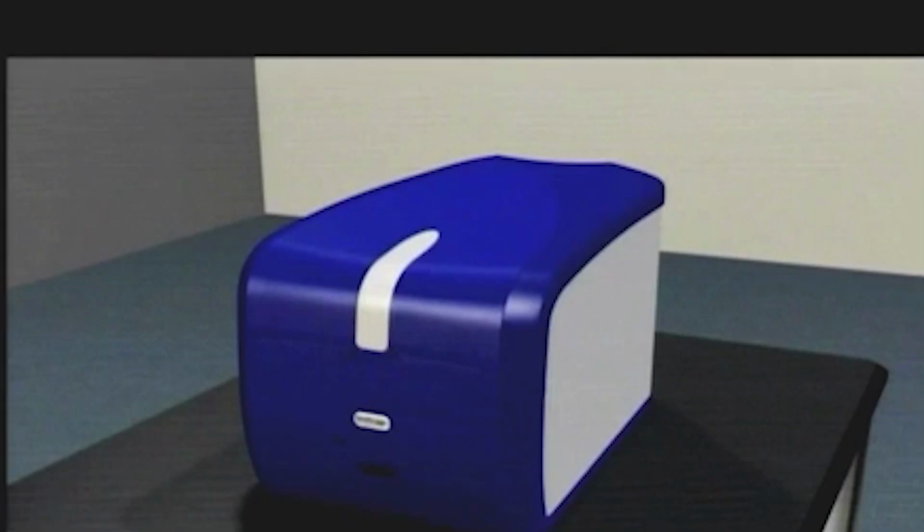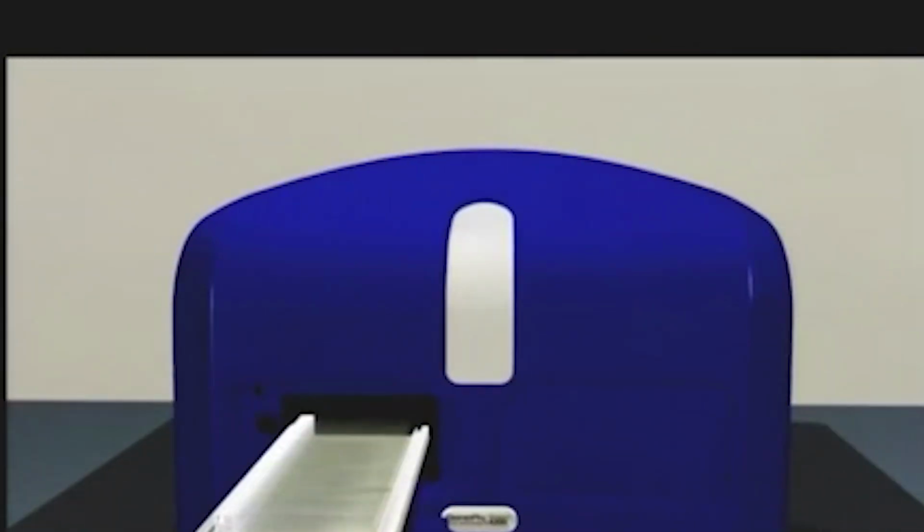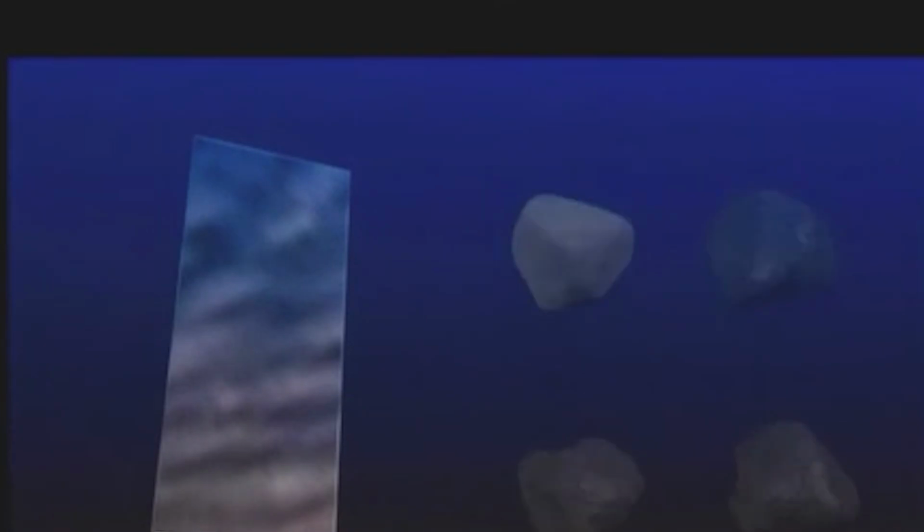Molecular Devices introduces the world's simplest, most reliable automatic microarray slide scanner. Now you can walk away from scanning while the GenePix Autoloader 4200 AL automatically loads, scans, analyzes, and saves results for up to 36 slides. The autoloader accommodates microarrays on standard glass microscope slides labeled with up to 4 fluorescent dyes. These microarrays can contain just a few hundred spots or tens of thousands of spots representing an entire genome.